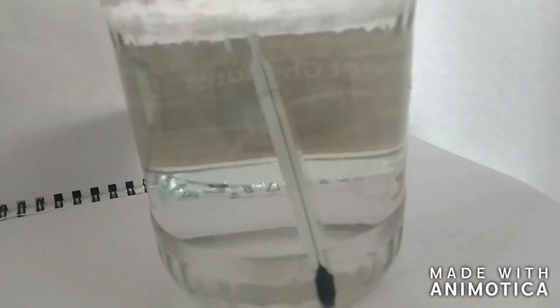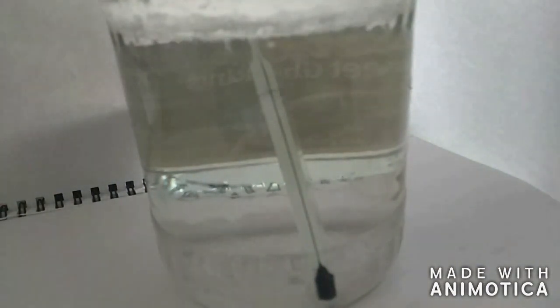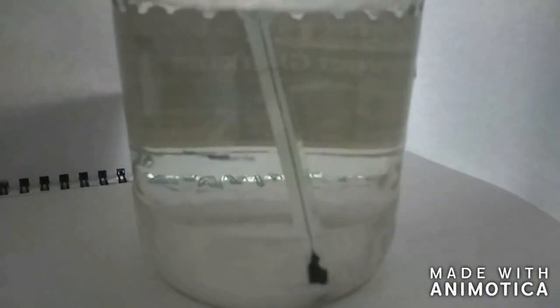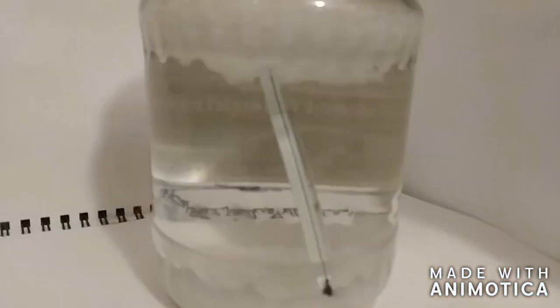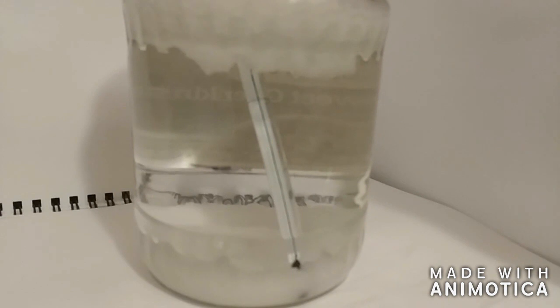And this was a bigger batch that I did. I thought that the time-lapse was interesting, so here you go. And also some very nice crystal structures right here.